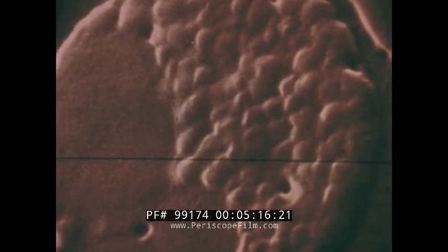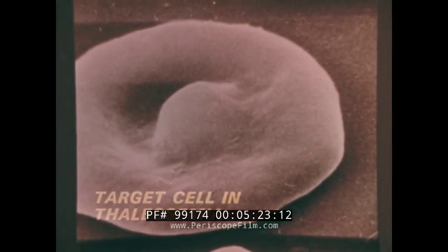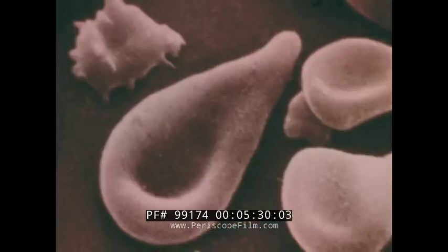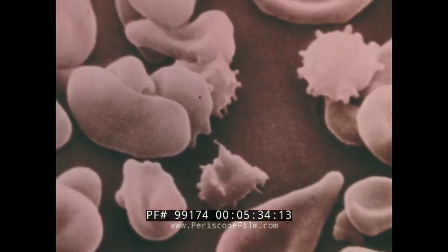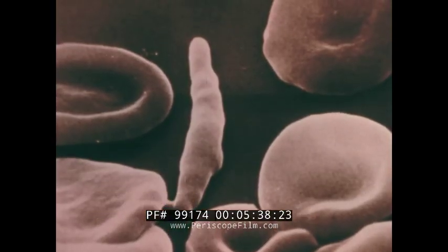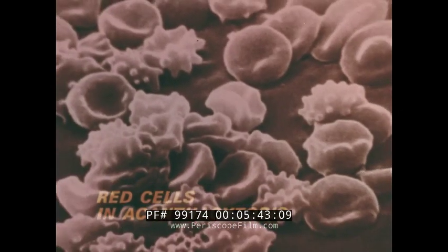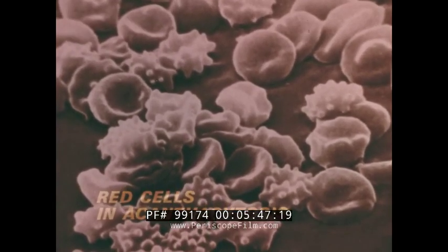We are only at the beginning in the present state of the art to connect the precise shape of the cell with the disease. This kind of red cell, the target cell, is often found in cases of thalassemia. Other bizarre cells are also found in patients with this blood disease. This form is characteristic of sickle cell anemia. Here are the strange shapes of red cells after cold agglutination in patients with acanthocytosis.